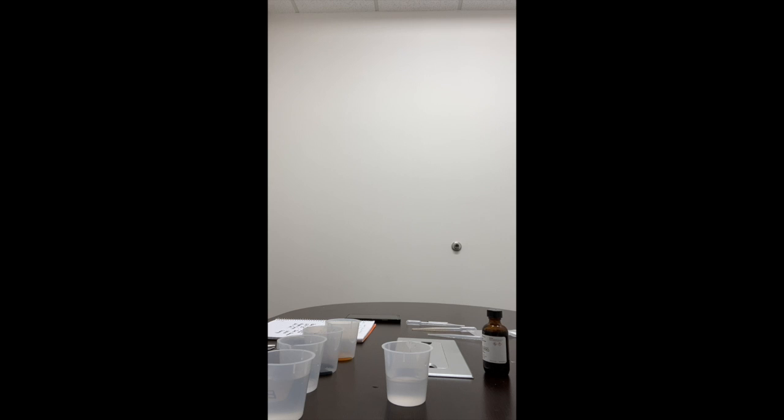Just drying off the tube. I have the tube folded a lot at the bottom and with a rubber band at the bottom.